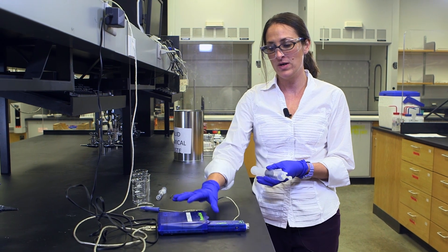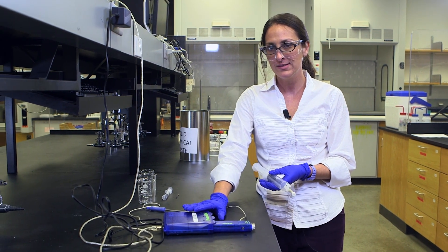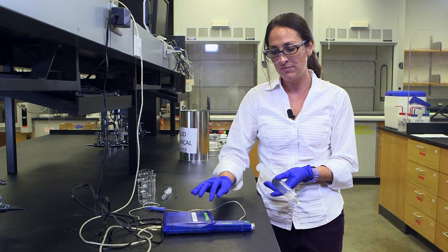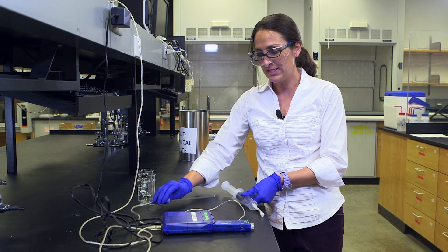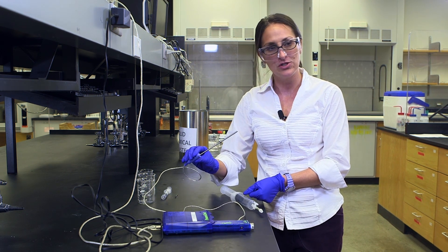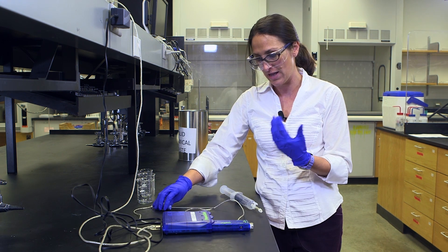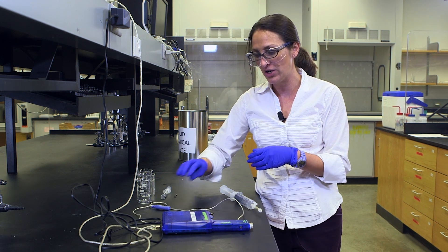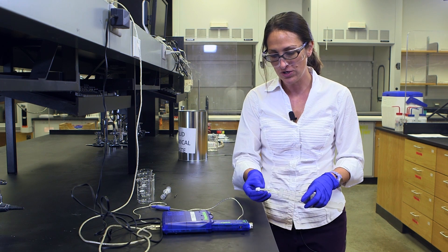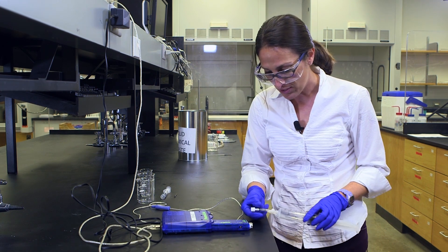We're using the Passport probe system with a temperature-pressure probe. This temperature probe is really just a digital thermometer that will give you a digital readout of the ambient atmospheric temperature on your computer. And this is the pressure port.